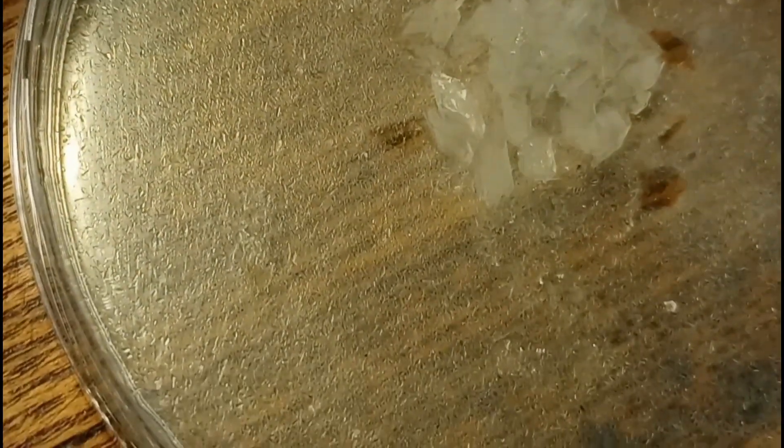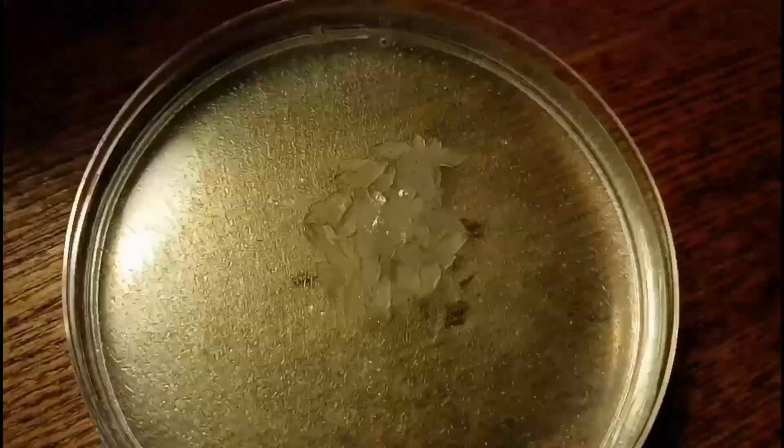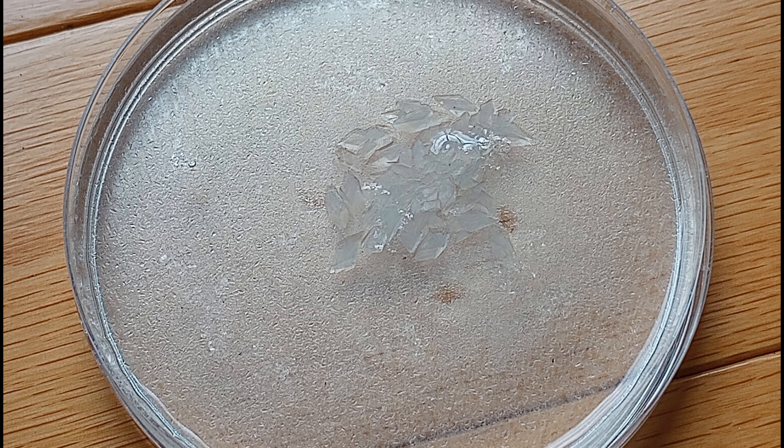I apologize for the really horrible camera work, but I wanted you to see that the entire bottom was coated in small crystals, and there was a clump of big crystals in the middle of the dish. I'll leave you with a few stills here. I think these are relatively pure zinc acetate crystals in this dish.